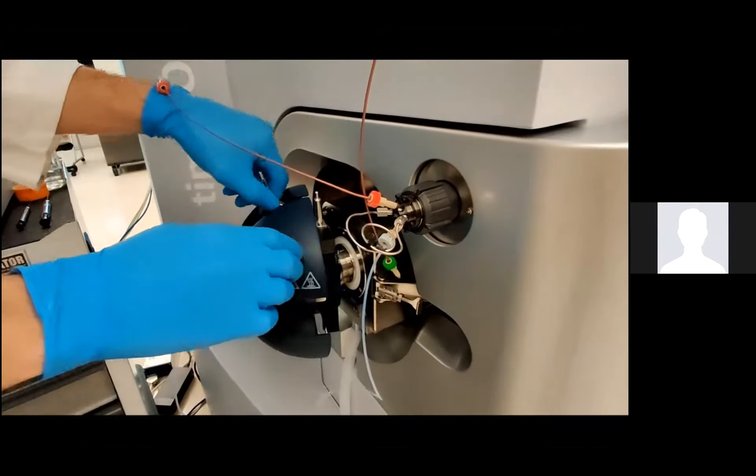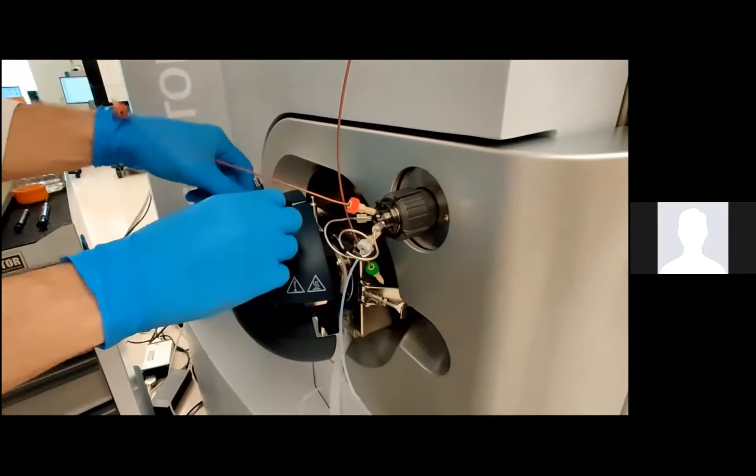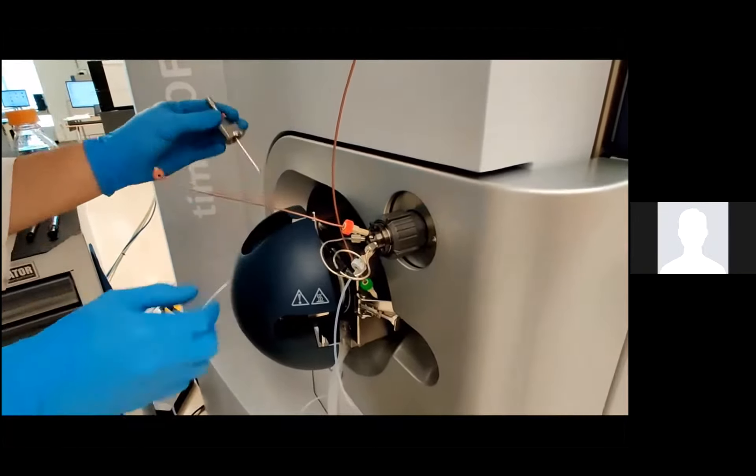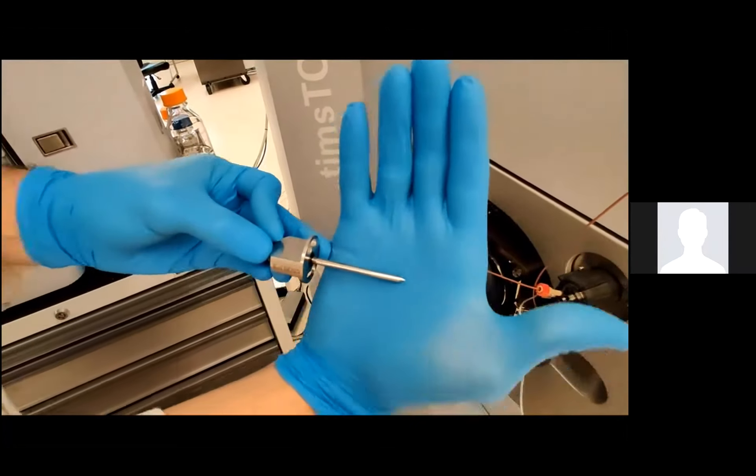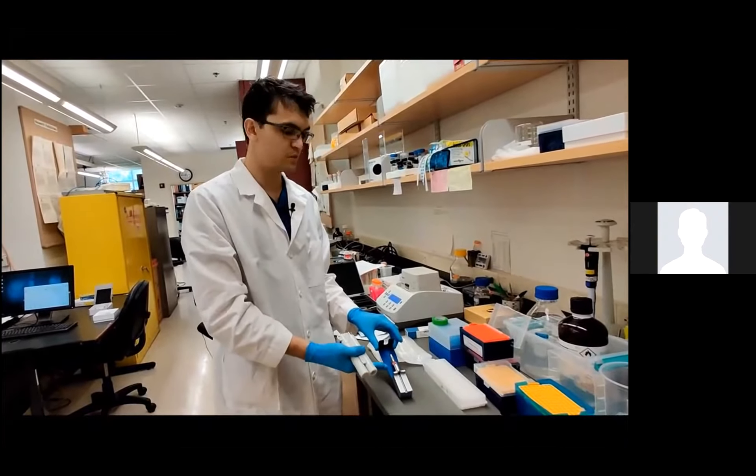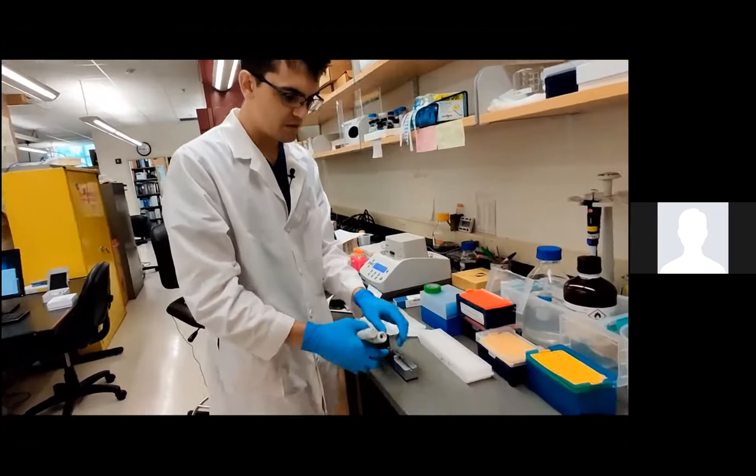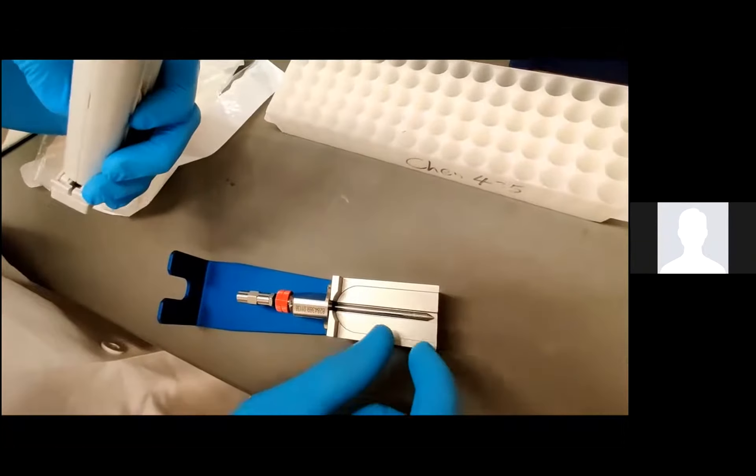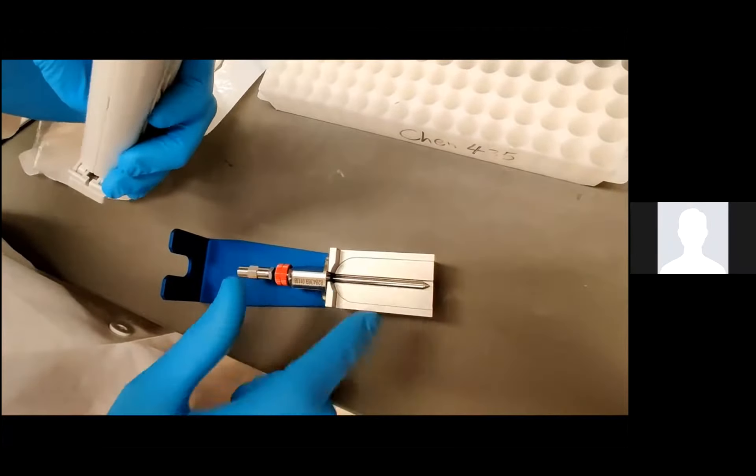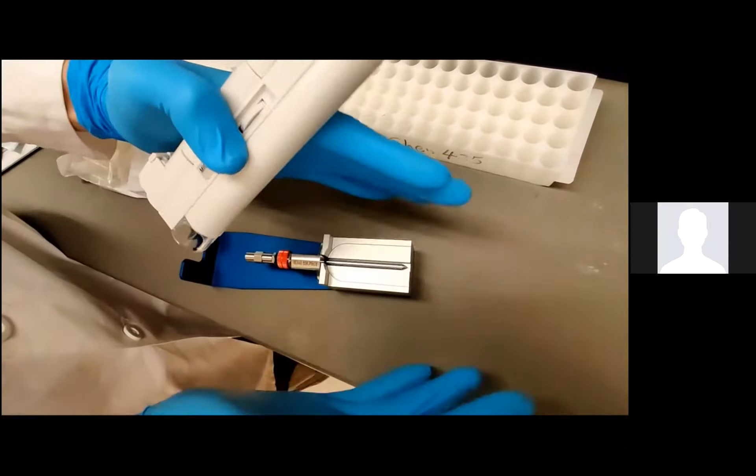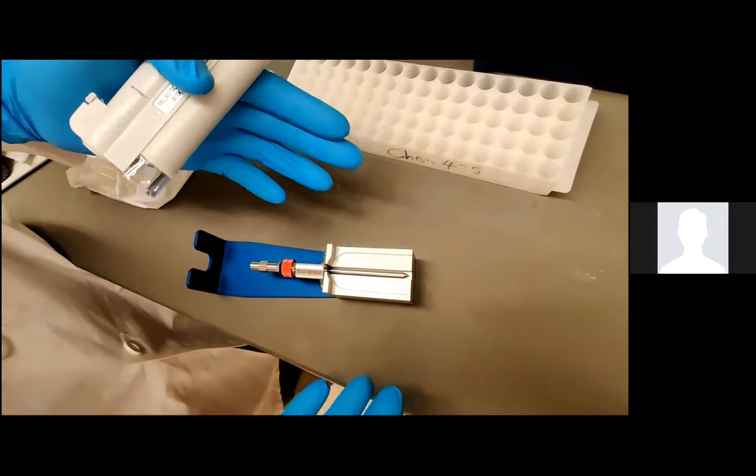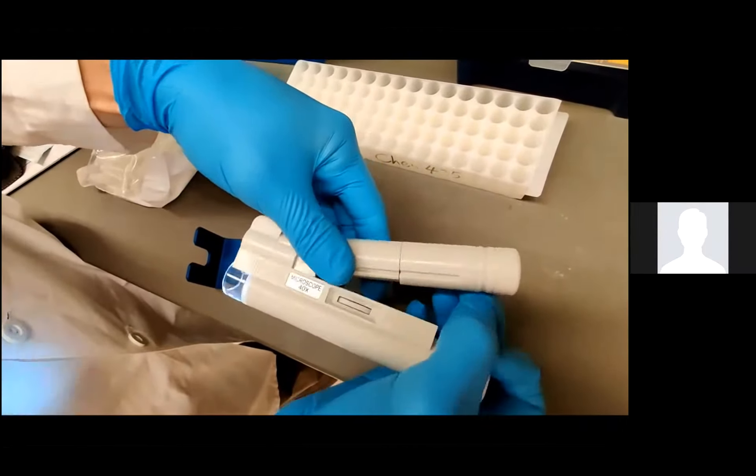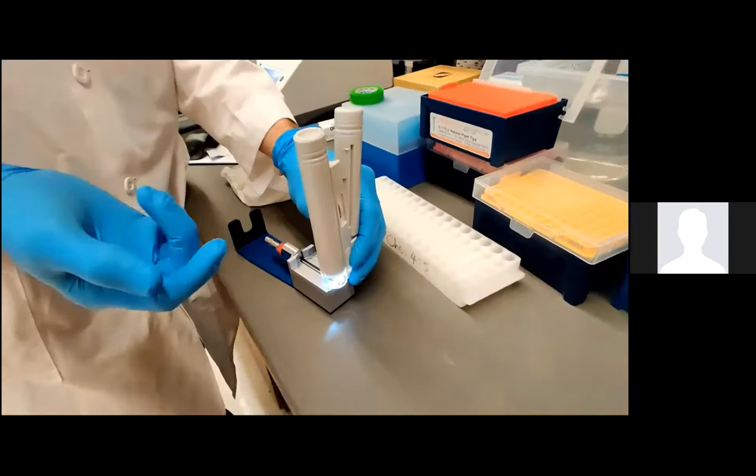In the Timstof, it's good because the capillary is orthogonal. As you can see, it kind of takes a right angle, which helps prevent anything dirty from getting actually into the instrument, which is good because this is easy to clean. So I do need to, though, pull off this ESI needle, which is a little bit finicky, and just inspect that little needle here under the microscope, which I'll do in a second. Bruker provides this little device that lets us view the tip of the needle here. The actual needle tip, which is at the very end here, needs to be a quarter of a millimeter out from the body of the source here. And that's what lets liquid flow with the enveloping gas at exactly the right dimensions to get good ionization.